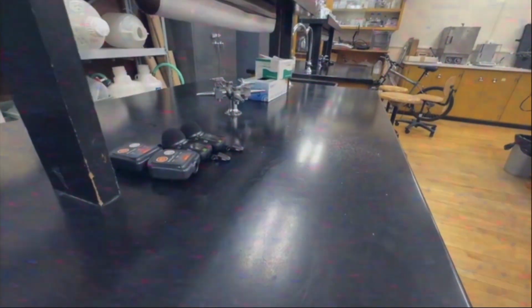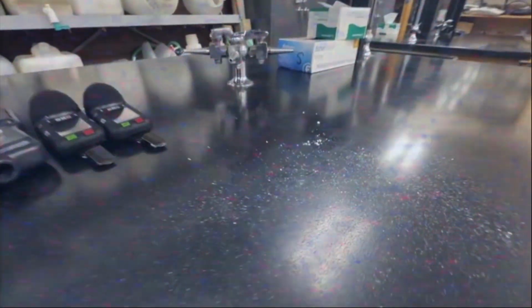For centuries, dust has settled on desks, on laboratory benches, and occasionally on other dust. Today, we will learn how the industrial hygienist confronts this challenge using two powerful tools, the wipe sample and the tape lift sample.